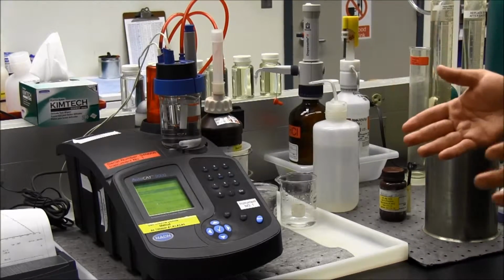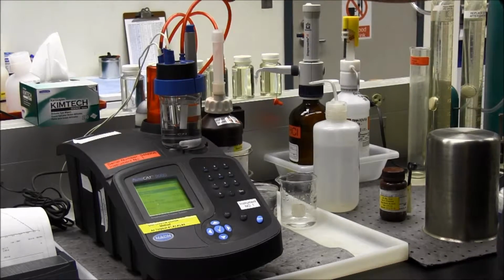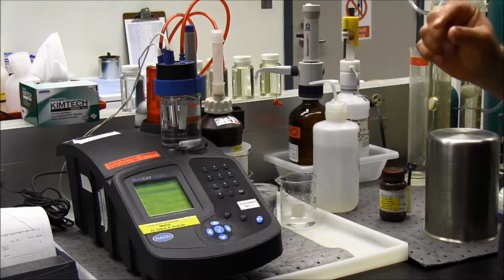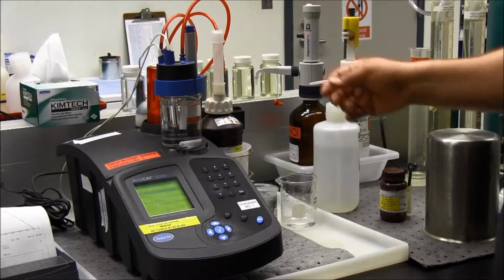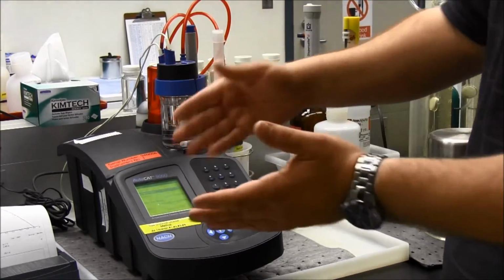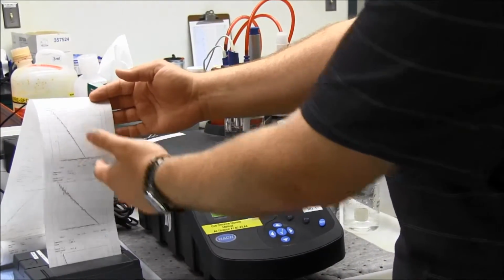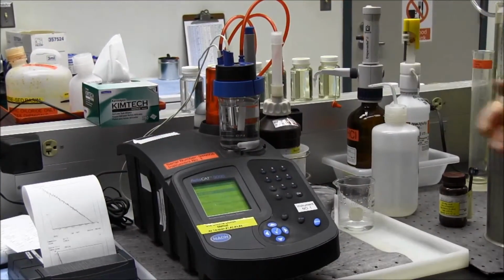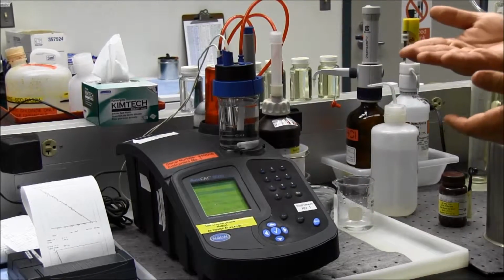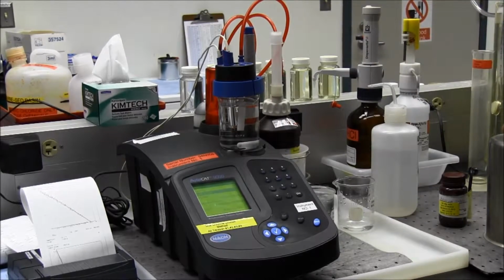The things that you really need to make sure that you do is purge the air bubbles out of this. Like I said before, it takes such a small amount of titrant to make this test work. If you have any sort of air bubble in there, it will throw your graph way off. If you see your graph and it's acting really weird, a lot of the time it's due to an air bubble that's trapped in the line that gets in there to where it thinks that it's dosing that titrant, but it's actually just feeding the air bubble into the sample.